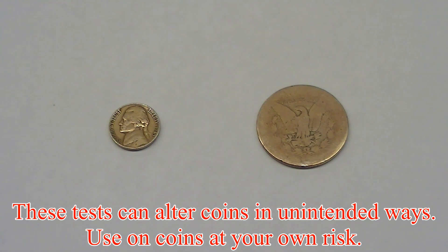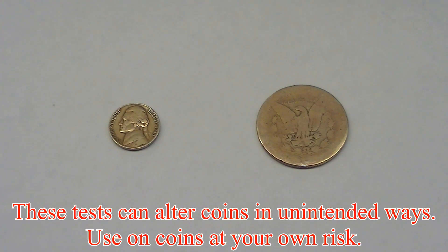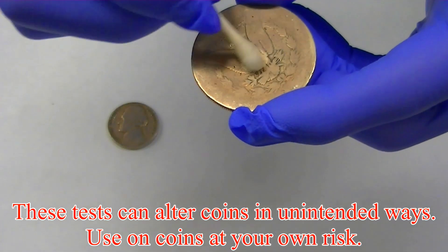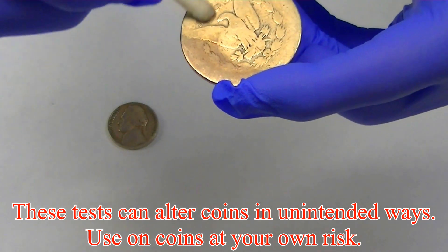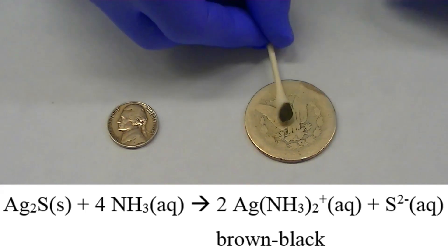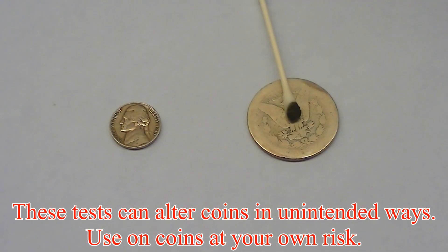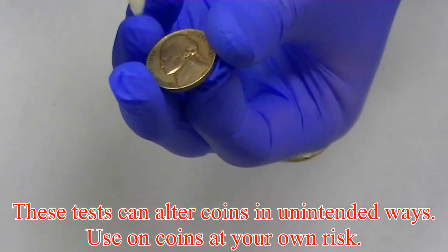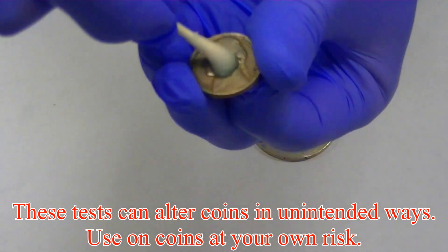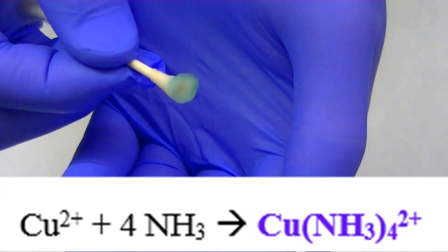Let's try some of these chemical tests on actual coins. First we're going to try the ammonia test on this silver dollar and this nickel. On the silver dollar, the ammonia makes the coin more shiny and we get the black colored product — there's definitely some silver in this coin. On the nickel coin, it doesn't appear to become more shiny, but we do see evidence of a blue color, so that nickel probably contains some copper.